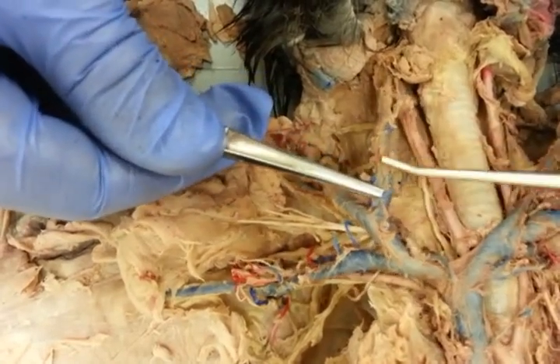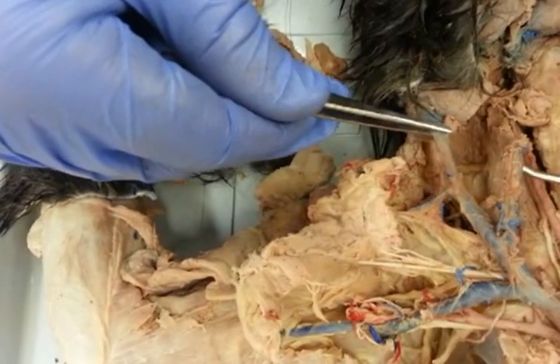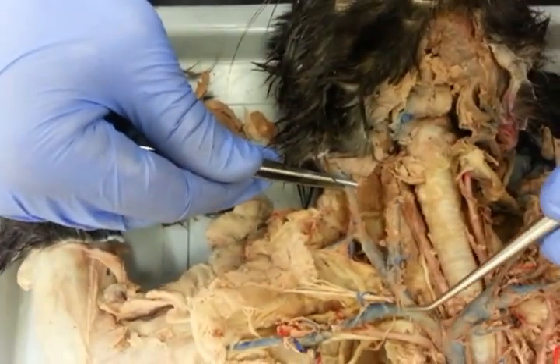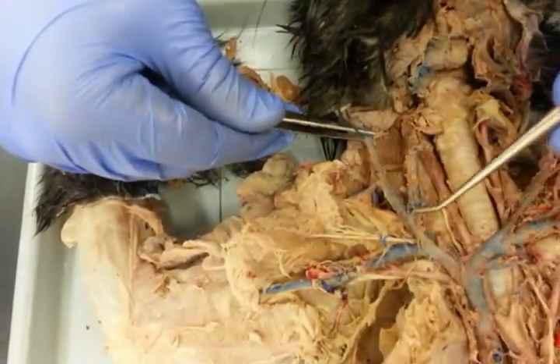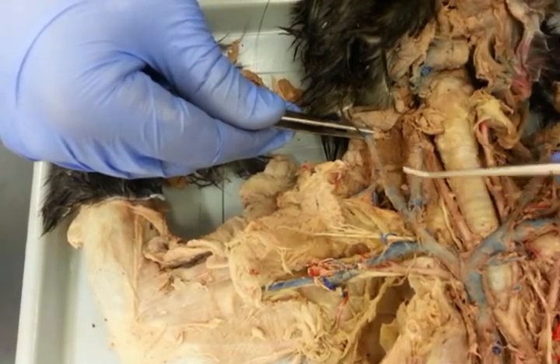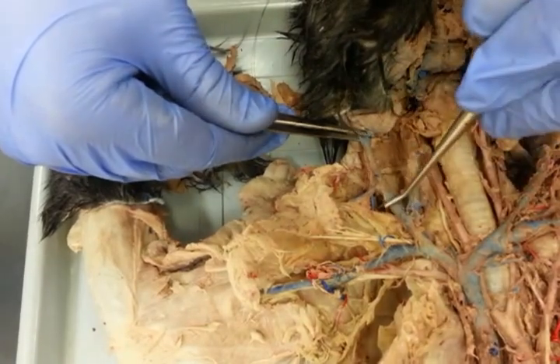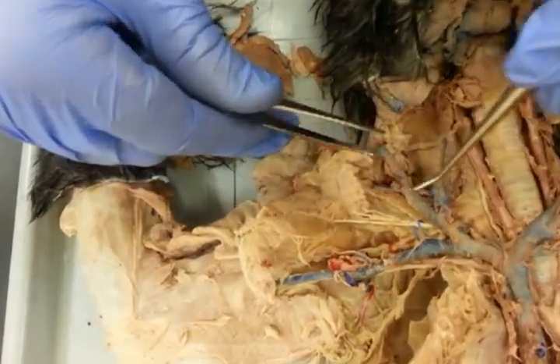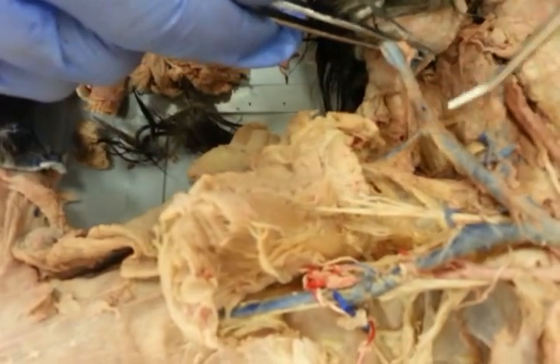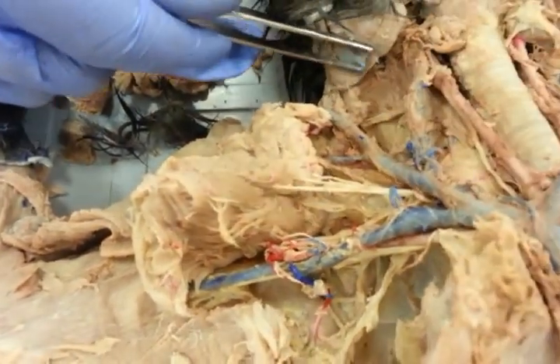We have an internal jugular, and then we have an external jugular that would attach right there. So we have right brachiocephalic to the bijugular trunk, to the right internal jugular, and the right external jugular. The right external jugular, we may not need to know it, is going to be cephalic, which runs off right there. That's it.